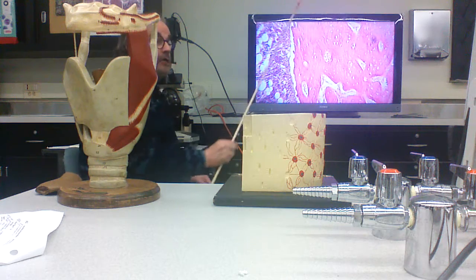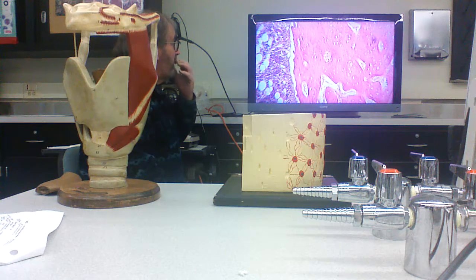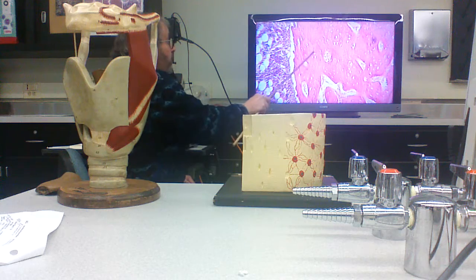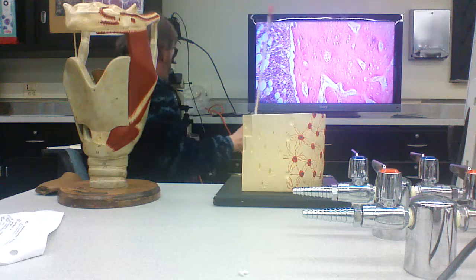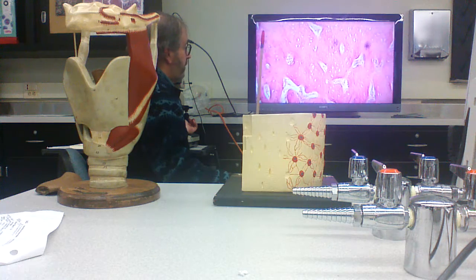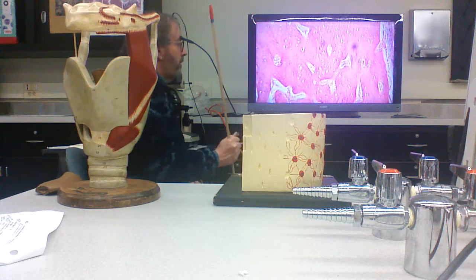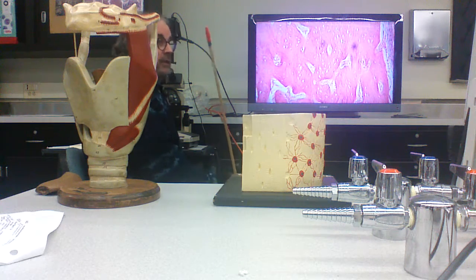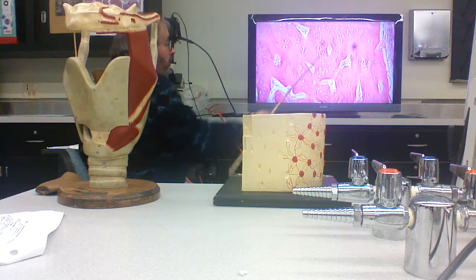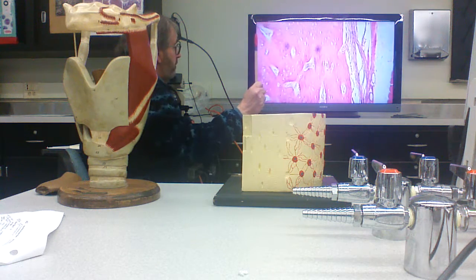Now, these used to be osteoblasts, which differentiated from osteogenic cells, and they essentially have sealed themselves into the bone matrix that they supply, that they've secreted. Right? And that bone matrix is going to mineralize outside of the cells as dissolved calcium and phosphate are going to bind to various mineral binding proteins.